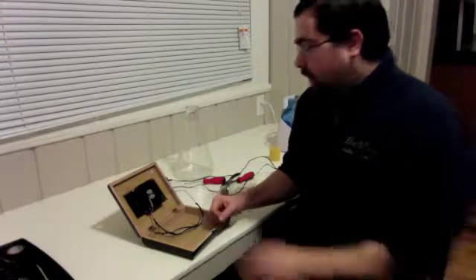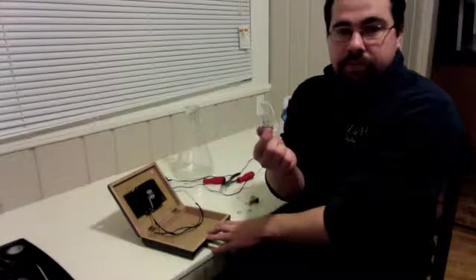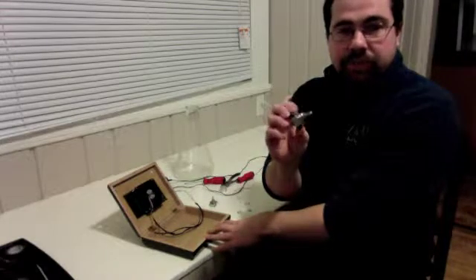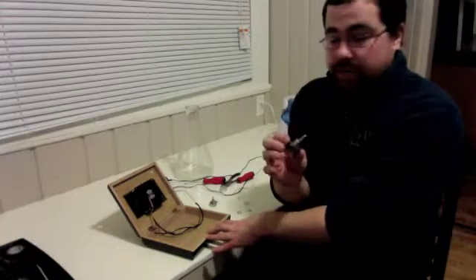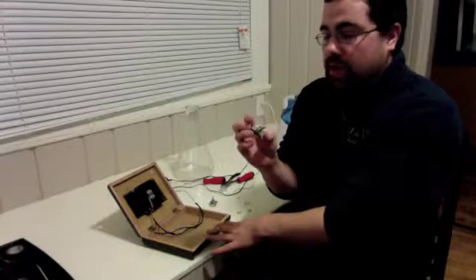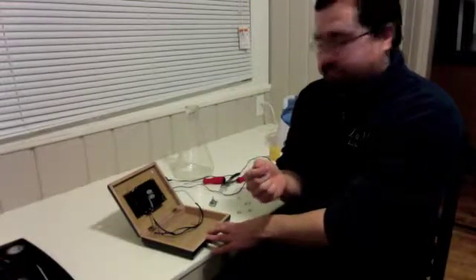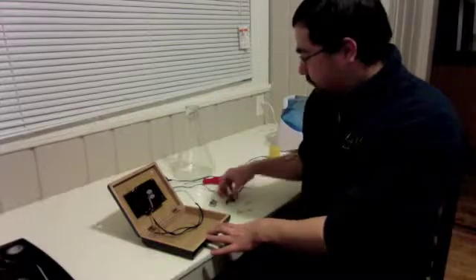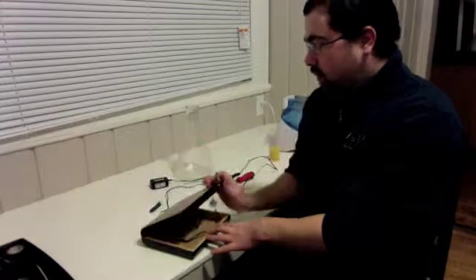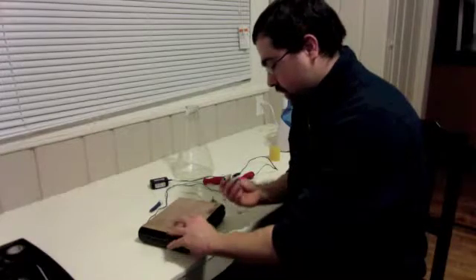So beyond that, I'm going to show you how to add variable control with a rheostat and the installation of an on and off switch, which is very nice, very helpful. Otherwise, with the simple version or without the on-off switch, you're going to be turning it on and off by plugging and unplugging it. Alright, so the first thing we're going to do is get the on and off switch in there, and I already have a hole placed for it. And that's just going to fit right up.